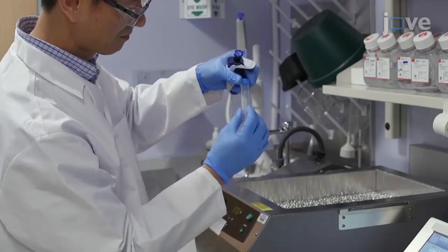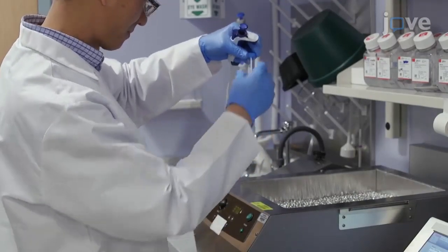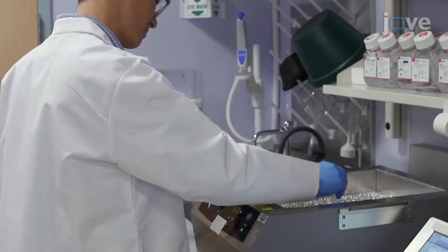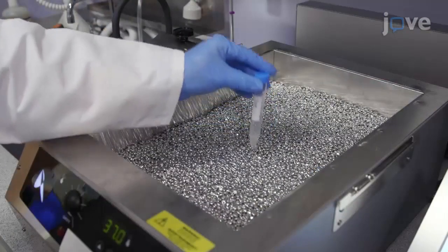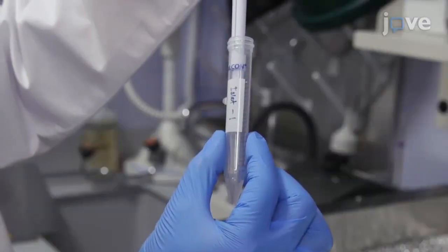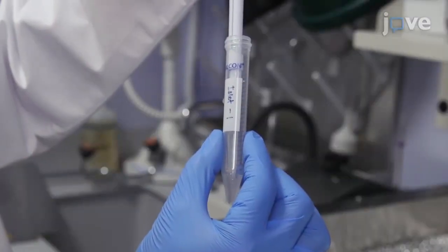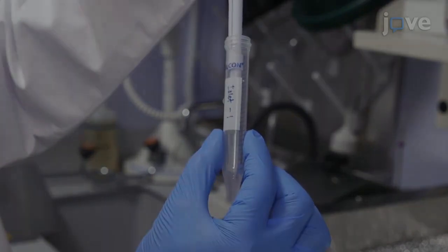Incubate the islets at 37 degrees Celsius for 9 to 11 minutes. Every 3 minutes, pipette up and down slowly for 10 seconds to dissociate the cells into single cells.